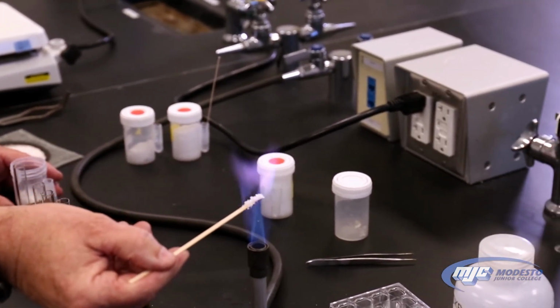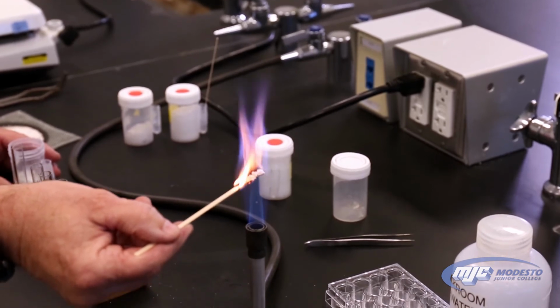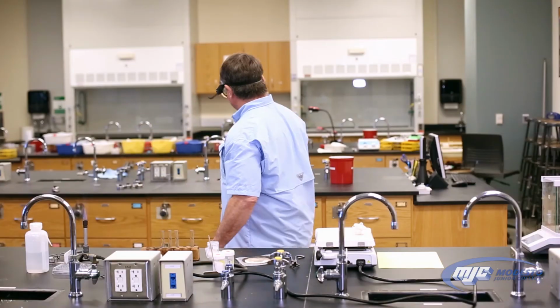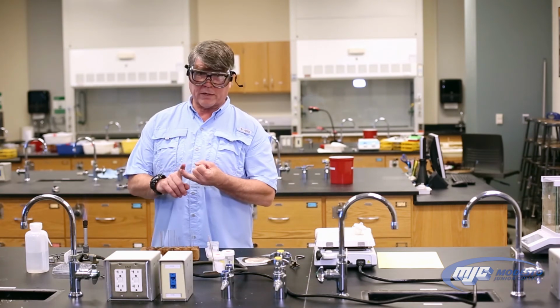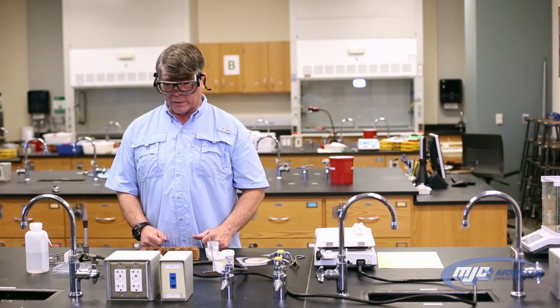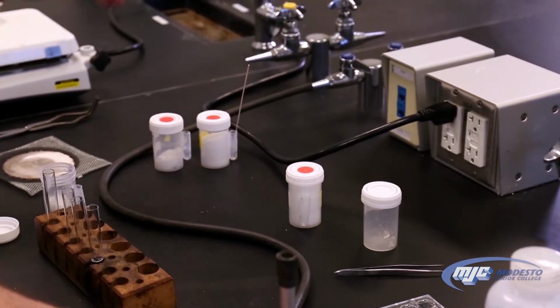See that lavender purplish color? That tells us that we have potassium atoms in there, and so our anhydrous salt is potassium carbonate. Now, if we get neither one of those colors, then that tells us that we don't have strontium chloride, we don't have potassium carbonate, so we're lucky enough to be able to do the magnesium strip test, which we'll do right now. But we're finished with this flame, so we're just going to turn it off and set it aside.